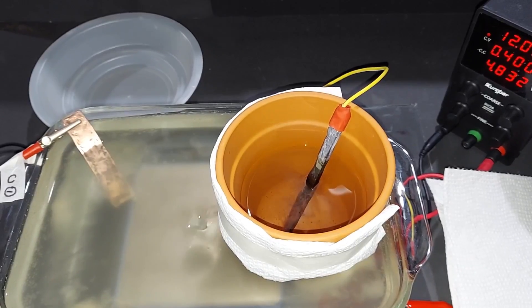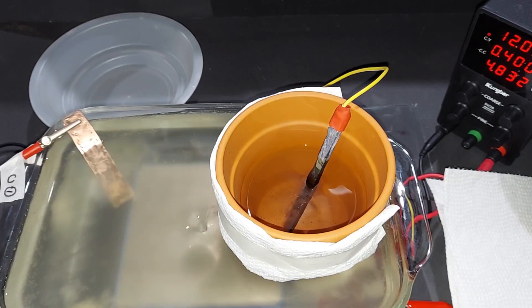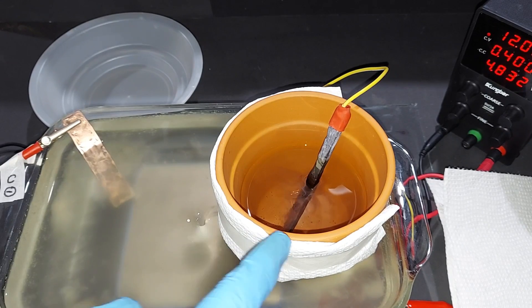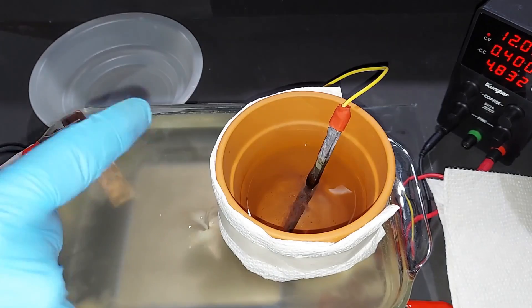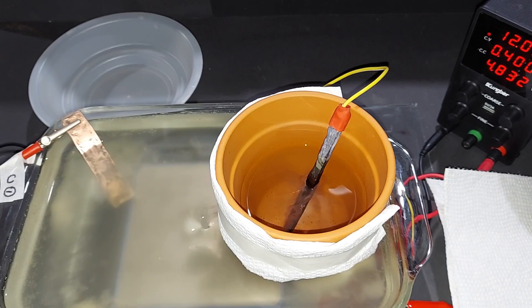It's been 30 minutes and our amperage has actually dropped slightly, so it's definitely time to call it quits. As soon as the circuit stops running, the ions will be free to start going the other direction through the pot. I'm going to pull out the lead electrode and dump the sulfuric acid into a beaker right away. This paper towel prevents any magnesium hydroxide from dripping down the pot into the sulfuric acid.